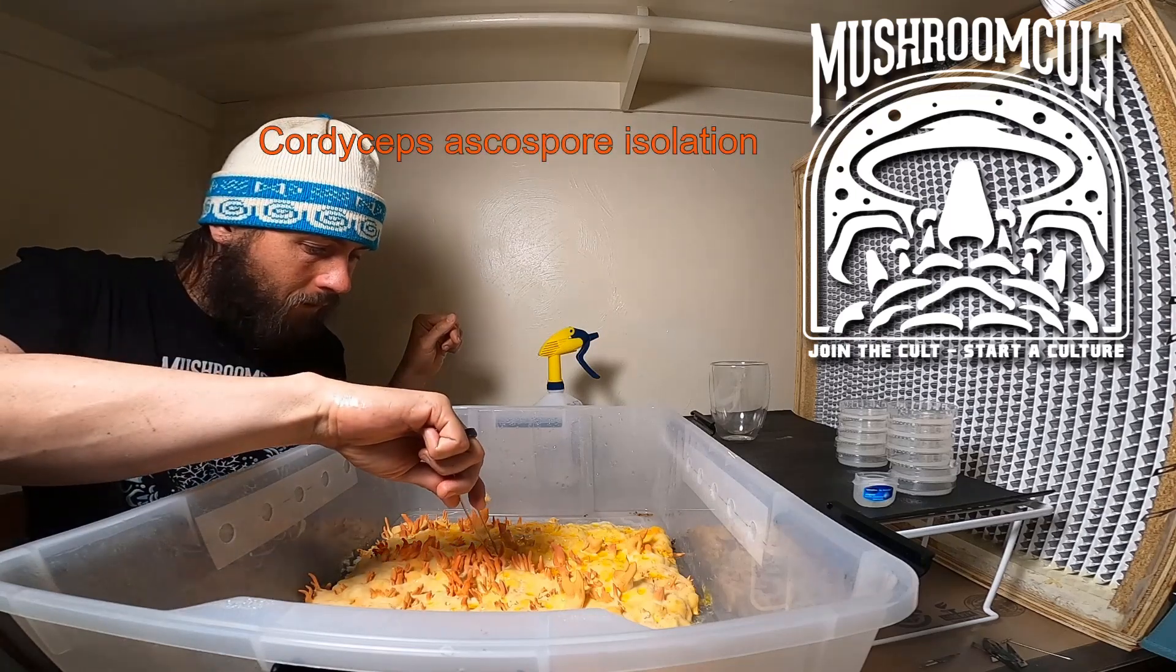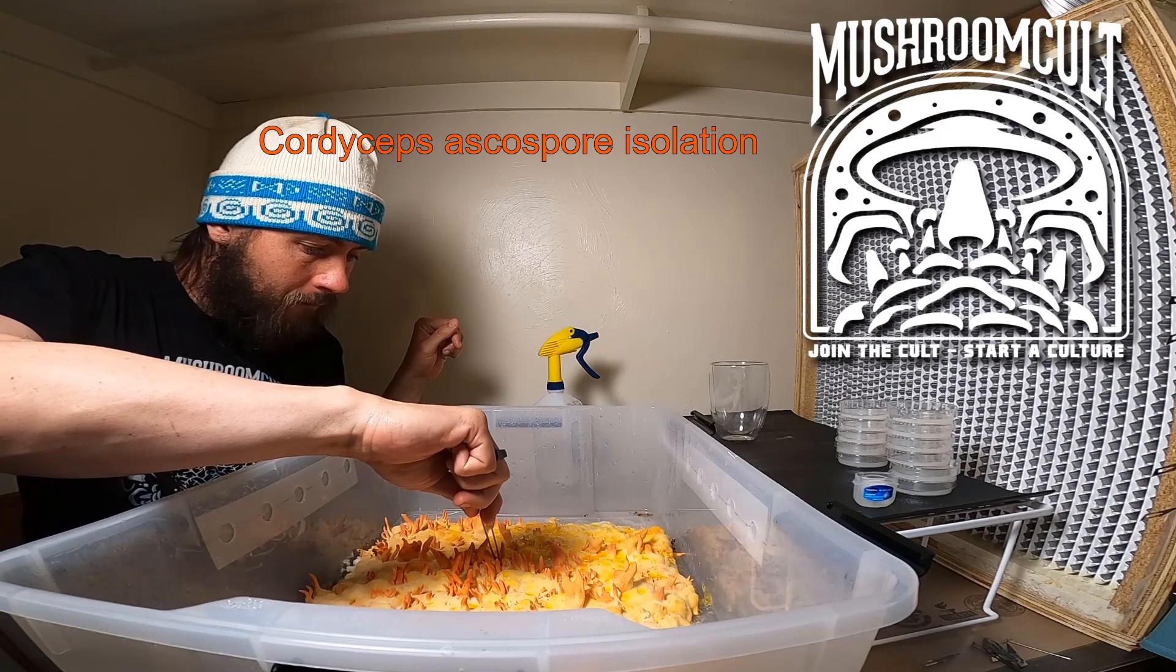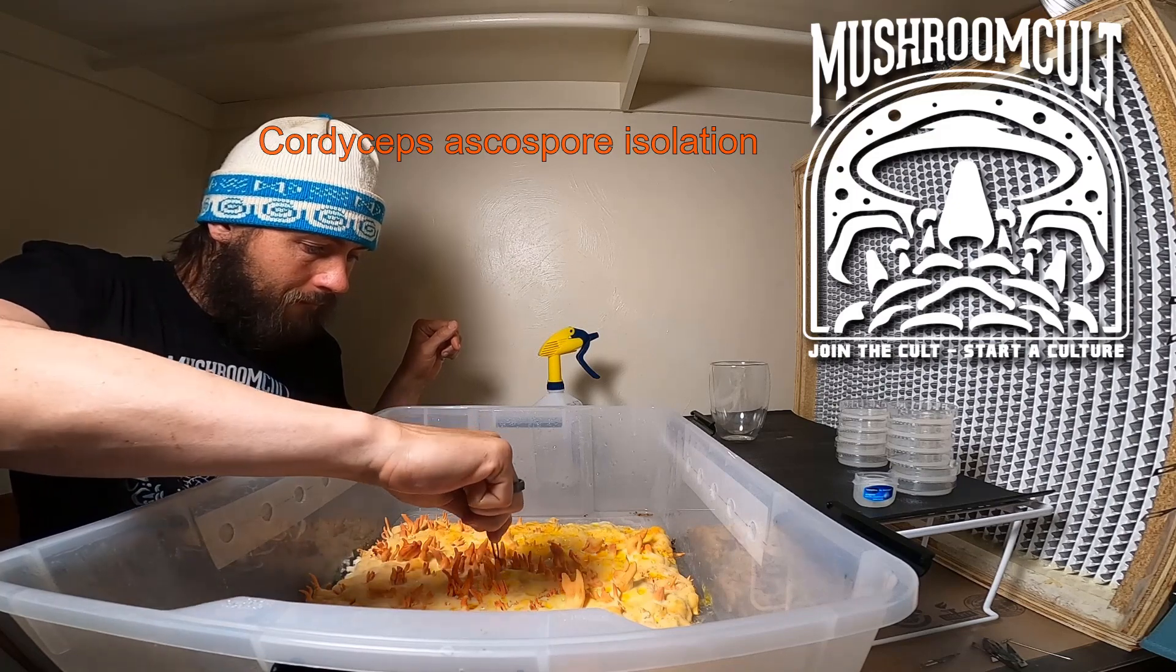Welcome to the Mushroom Cult. Today we are isolating ascospores from cordyceps.